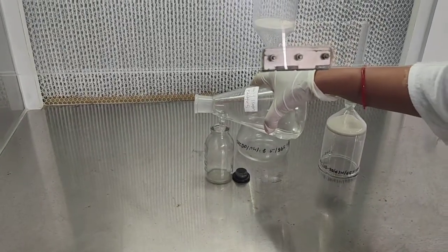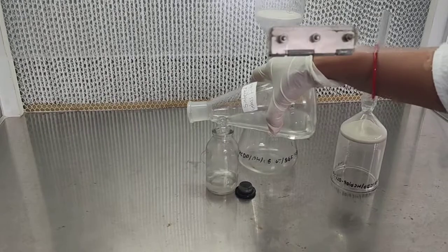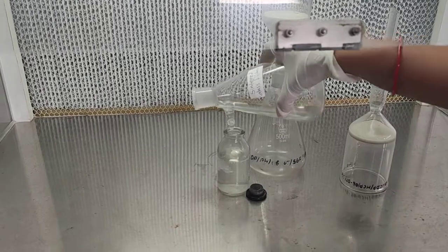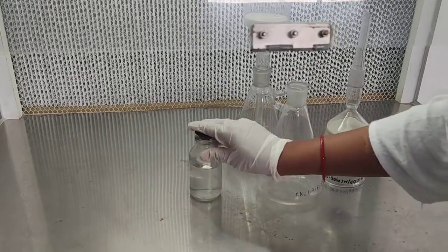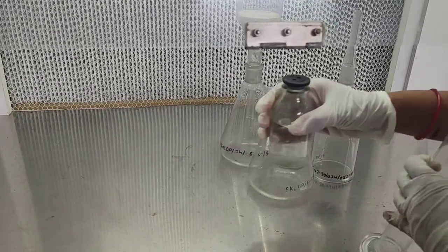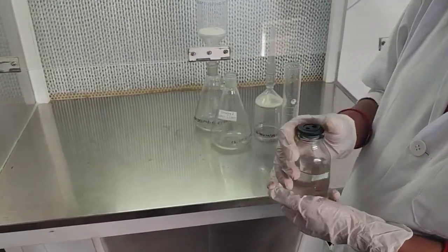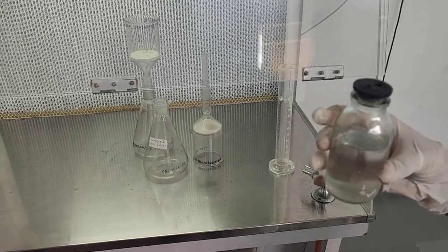After filtration, the injectable is filled into the final container inside the laminar air flow unit, ensuring no contact with the outside environment. We fill it and seal it inside the air flow unit so that the preparation remains fully sterile.